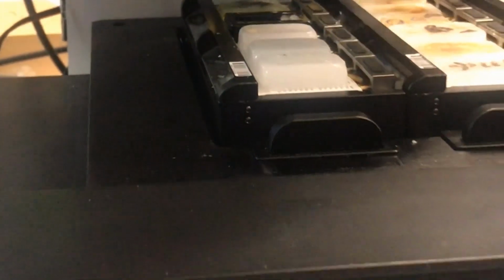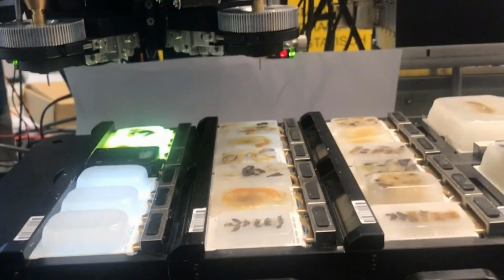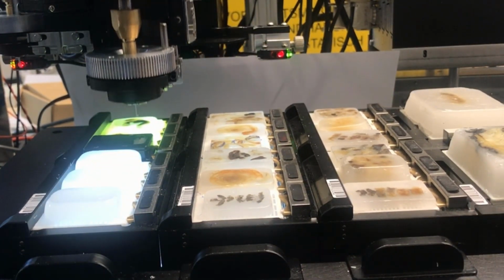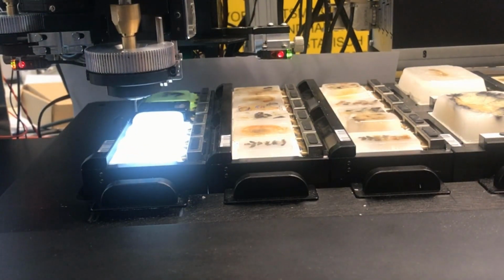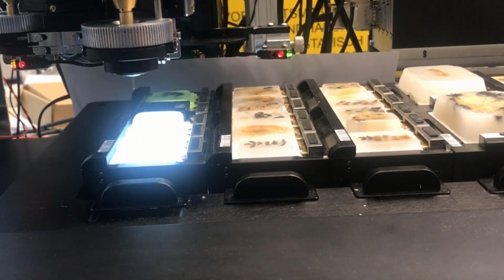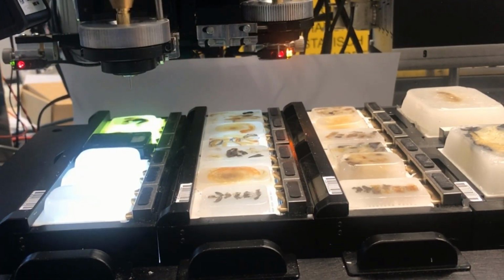The first operation is to measure the height of all tissue blocks on the table, including the macro and microfuge plates. The first step is to clean the recipient needle and check that it is free from residual paraffin. Position the recipient block in the correct position. Makes the hole in the recipient block. Moves the needle mechanism and cleans the donor needle. Then the donor needle gets cleaned before extracting the tissue core from the donor block.